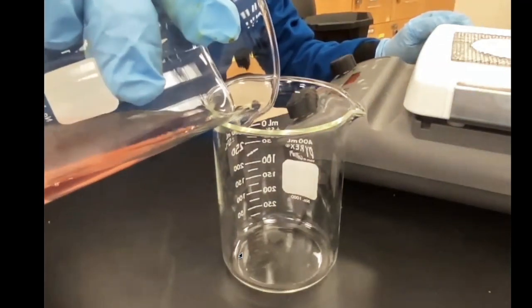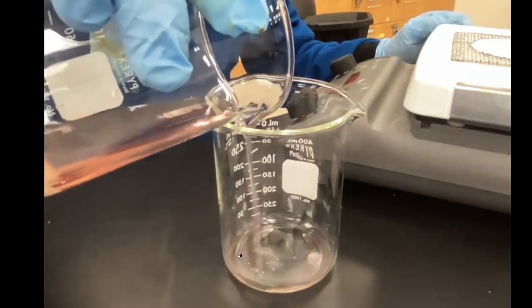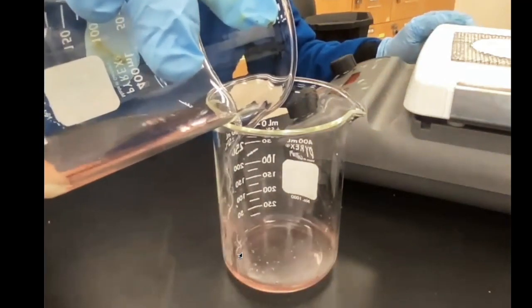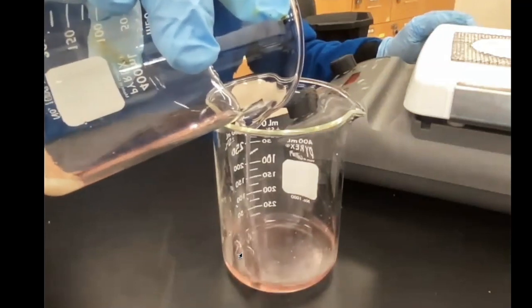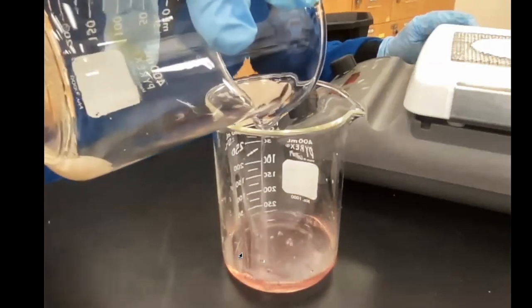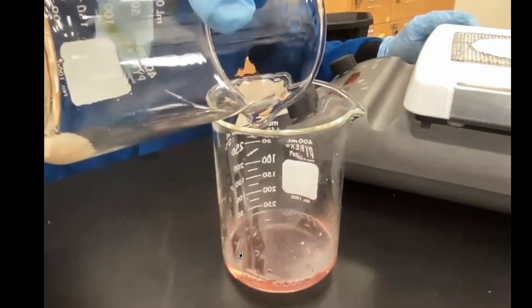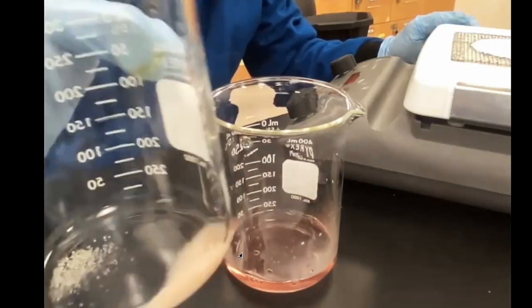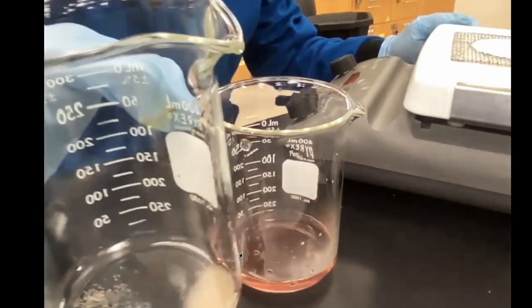And what I'm doing is I'm just decanting. This is called decanting, where you're letting gravity help you separate it. Now you don't have to decant all the liquid, but certainly this chemical right here which is B, because that's being separated, is now here.